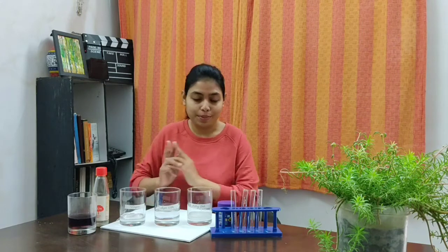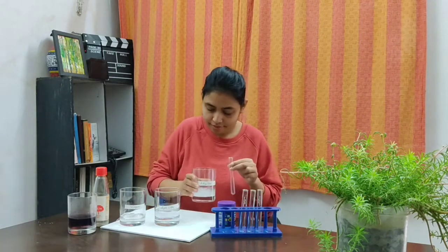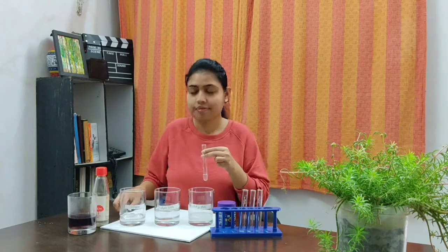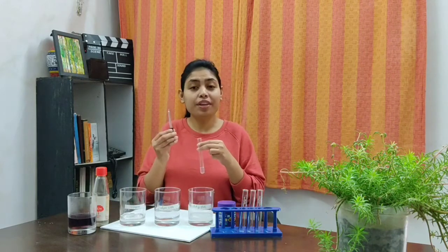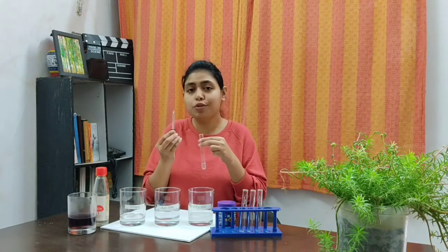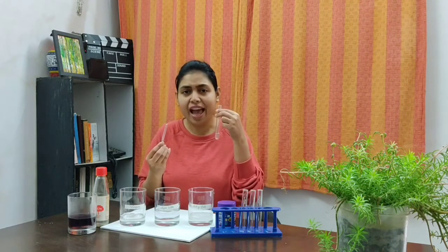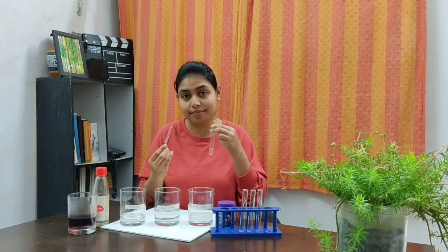Now let us perform our experiment. Firstly, I will take some baking soda solution in a test tube. Now, with the help of a dropper, I will put 2 to 3 drops of hibiscus indicator into the baking soda solution, and we will see the change in color.